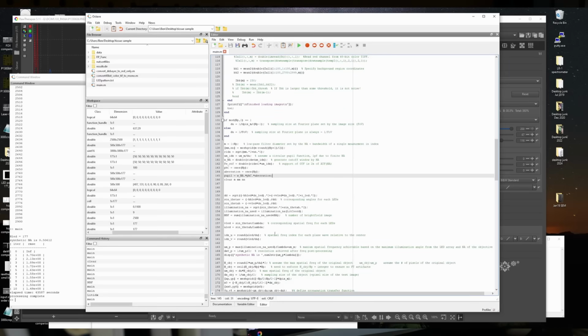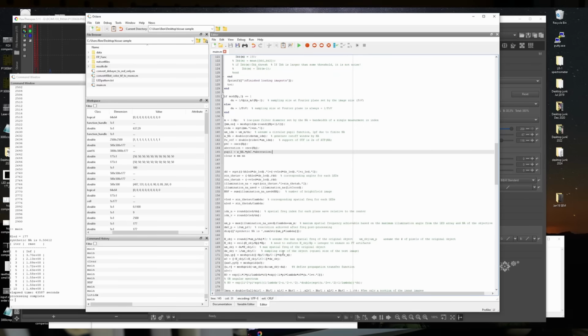A lot of this work is basically setting up the matrix that tells the system what spatial frequency it gets from each one of these acquired images. And just keeping track of all these different matrices is a huge amount of work. There's a ton of off-by-one style errors, where it's 0 index or 1 index, or row major or column major, or flip left, up, down, mirrored, left, right. It's a ton of stuff to keep track of, especially when you're coordinating between this and the firmware code in the real world. It helps a lot to come up with test lighting schemes that start off in one corner and go to the other corner to make sure that all the lefts and rights line up.